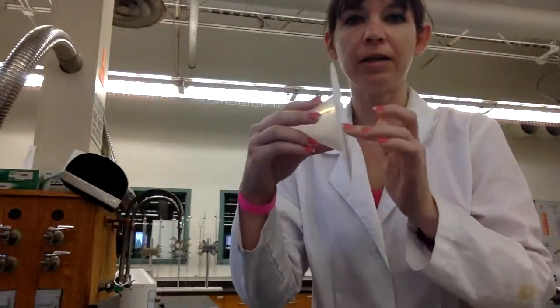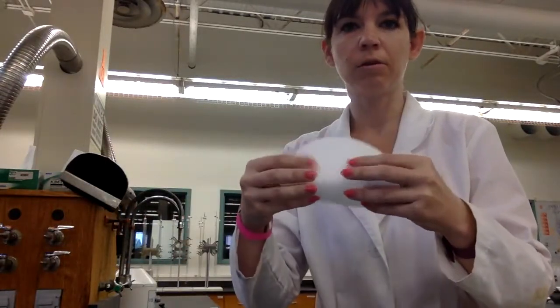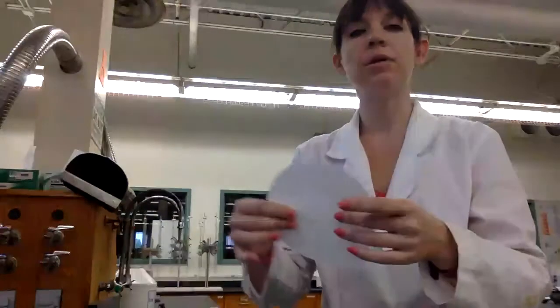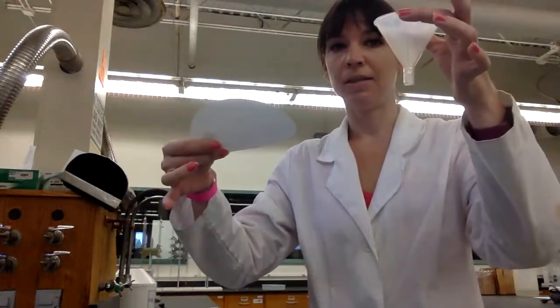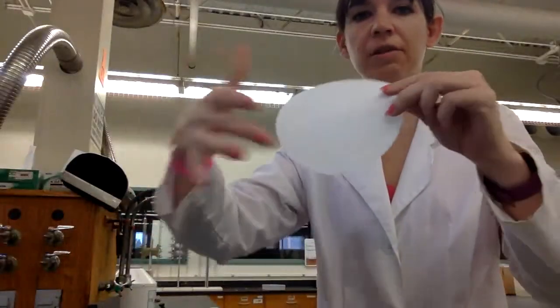But we're not going to just shove it in there. We're not going to fold it up like a fan or like a coffee filter. So I want to show you the correct way to fit this into your funnel. So it's very, very simple.